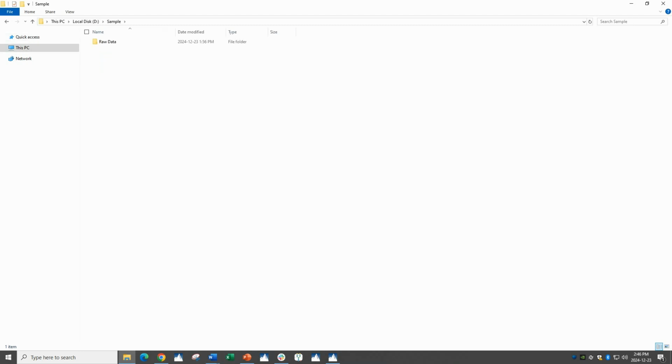Finally, let's go to the folder that our raw data is stored in. We recommend that your raw data be stored on a local drive and not a network drive prior to loading into Peaks. This decreases the chance of there being access issues. If you have multiple subfolders with different sets of data, then you only need to set permissions on the main folder.